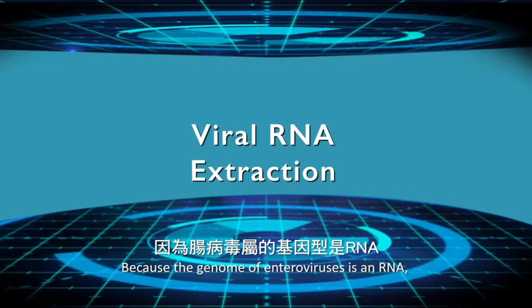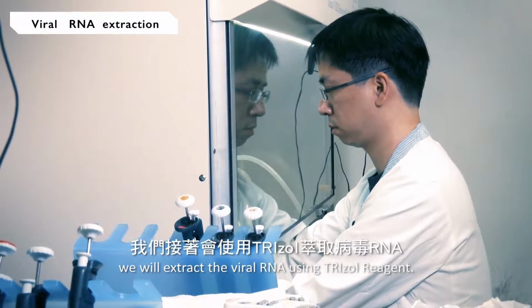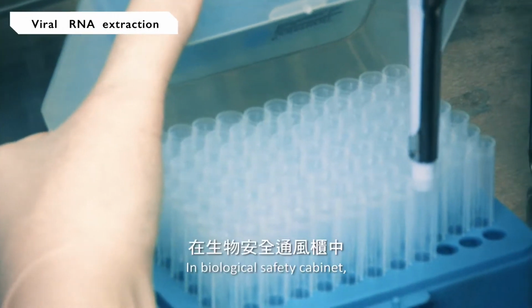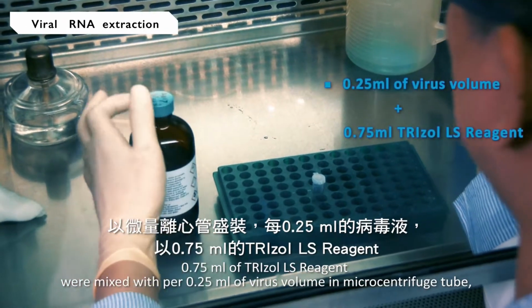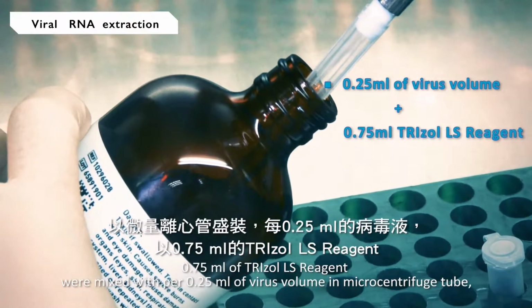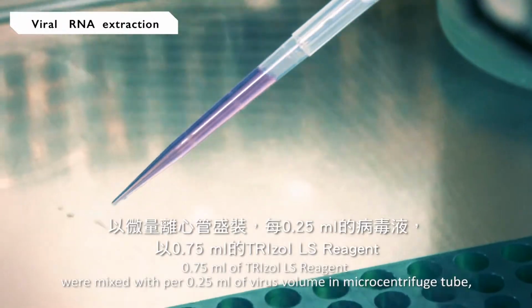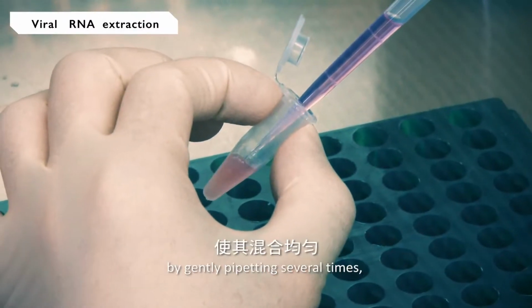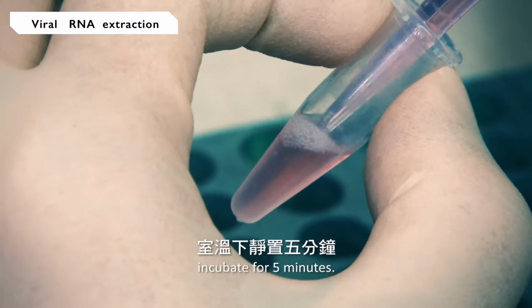Because the genome of enteroviruses is RNA, we will extract the viral RNA using TRIzol reagent. In the biological safety cabinet, 0.75 milliliter of TRIzol LS reagent is mixed with every 0.25 milliliter of virus volume in a microcentrifuge tube, and then homogenize the sample by gently pipetting several times. Incubate for 5 minutes.